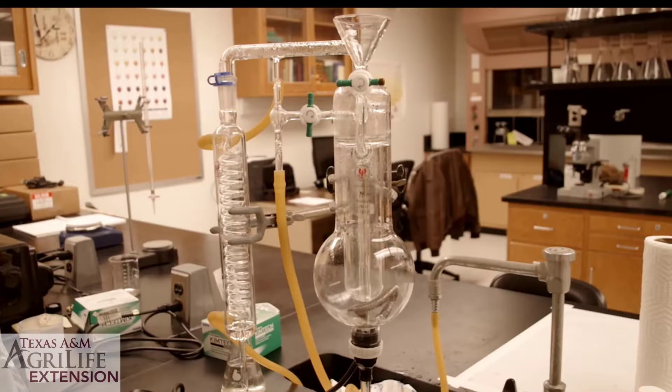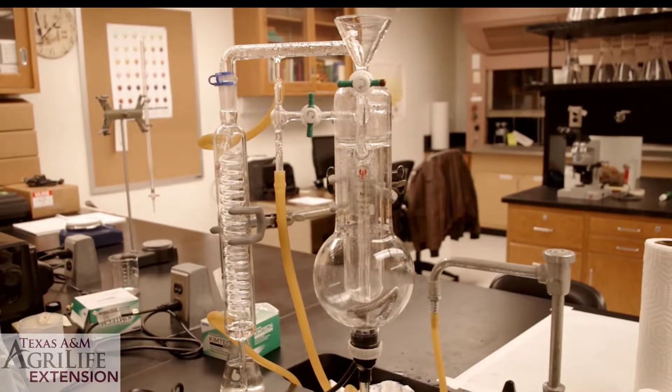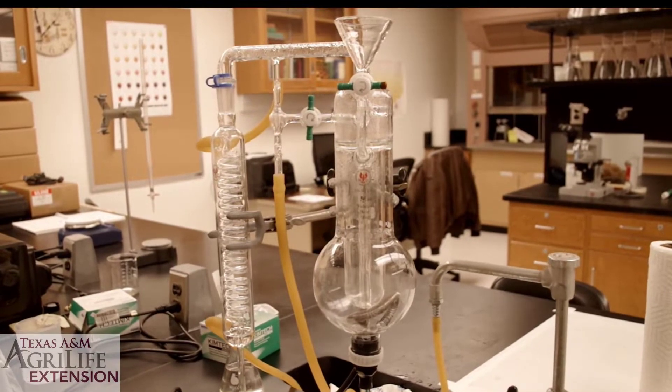Hello everyone. Today we will learn how to run a wine sample on a cash still in order to measure volatile acidity. Let's take a look at the apparatus first.